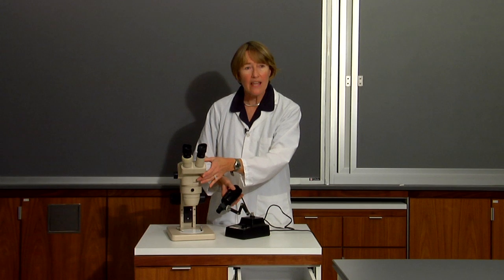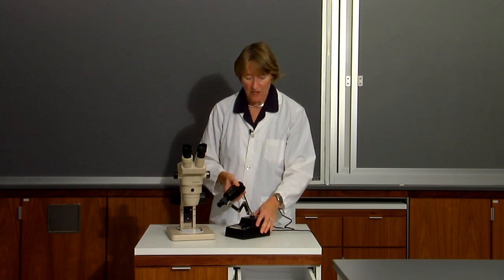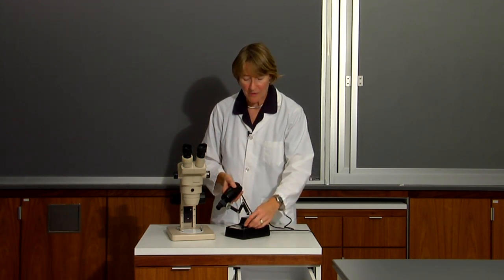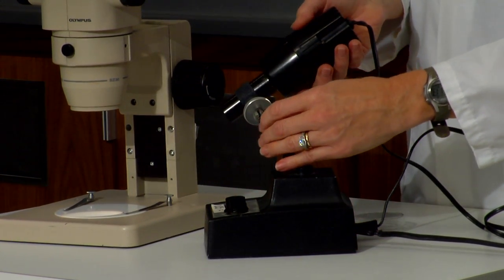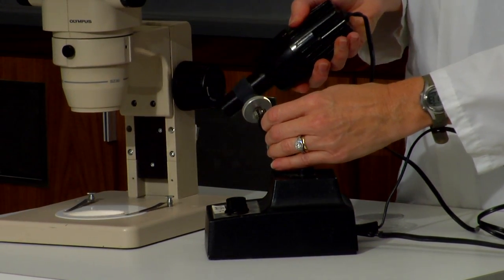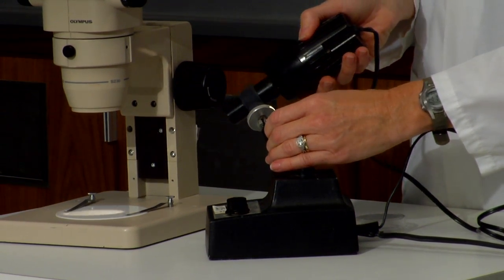The lenses are just as good as the ones that we have for the newer microscopes. You just turn on the light source like this and you adjust it as need be onto your sample.